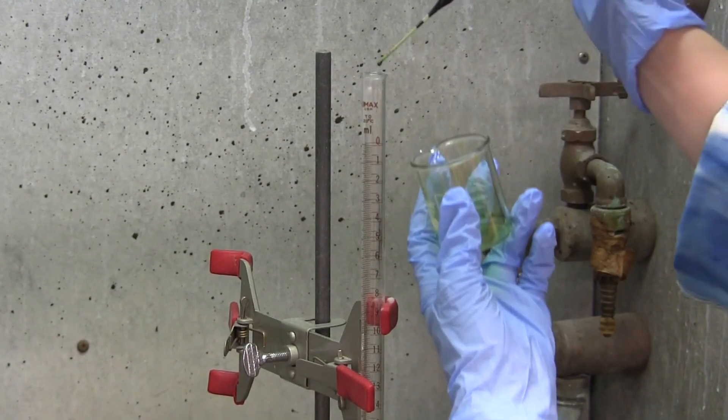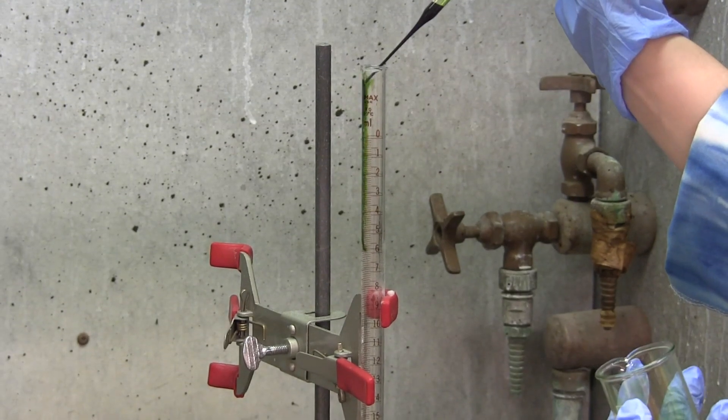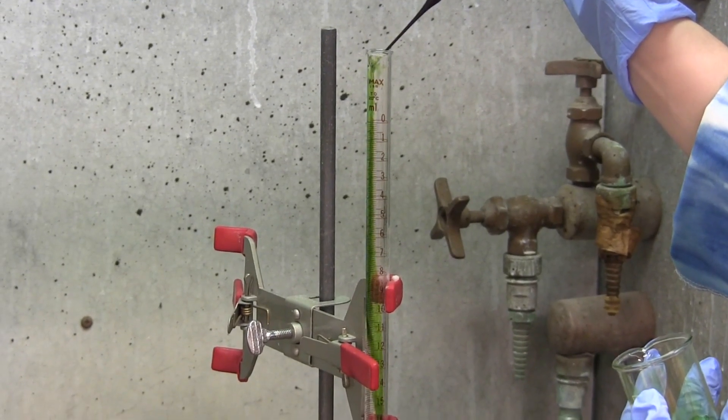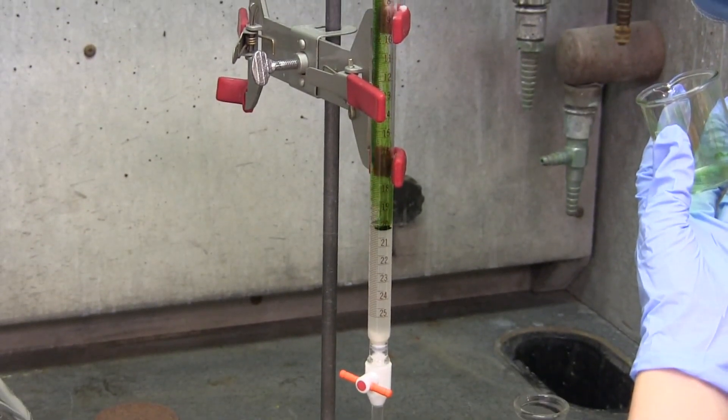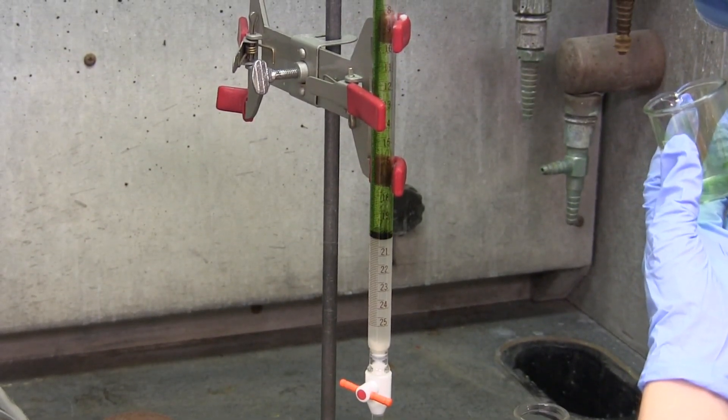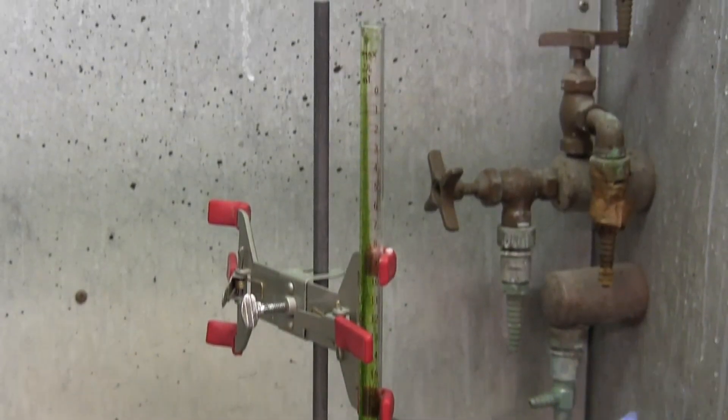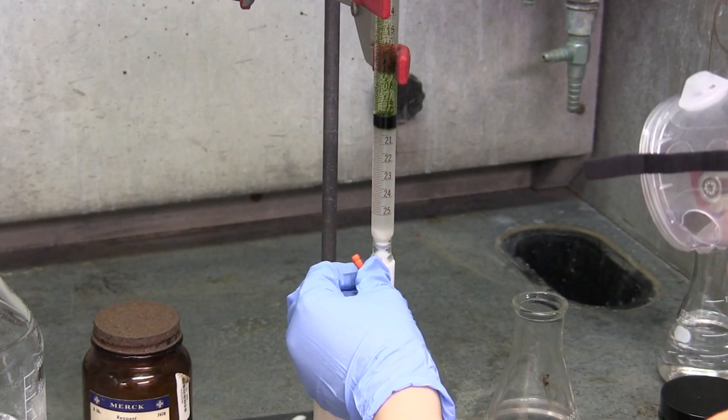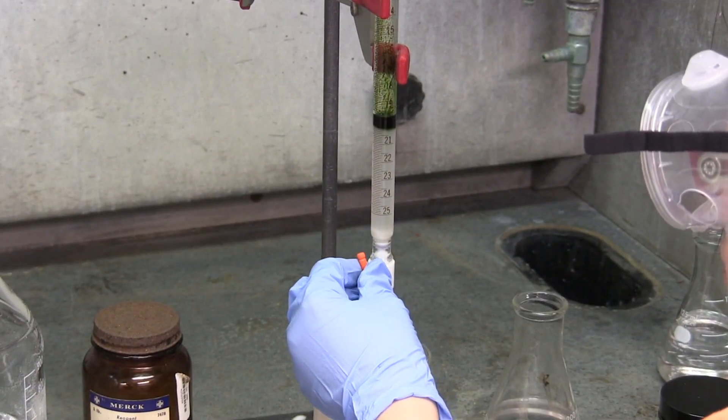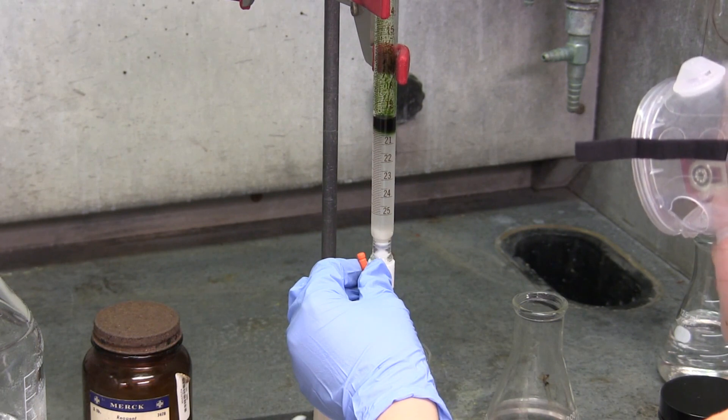Using a pipette, the spinach is added to the side of the burette so it may fall to the silica column without disturbing the column. The stopcock is then opened until the spinach sinks into the top of the silica column, and then closed.